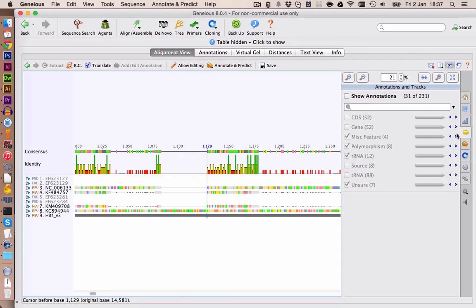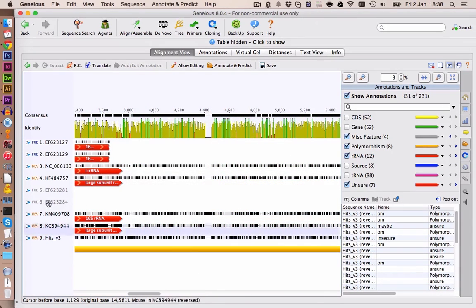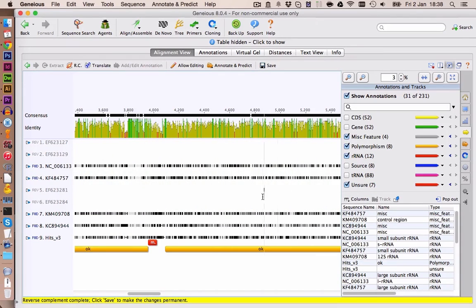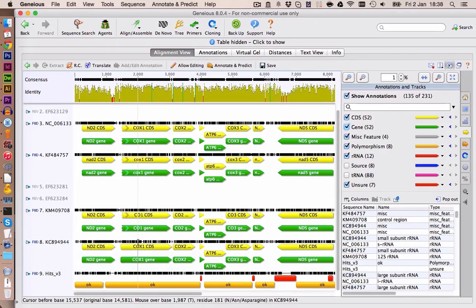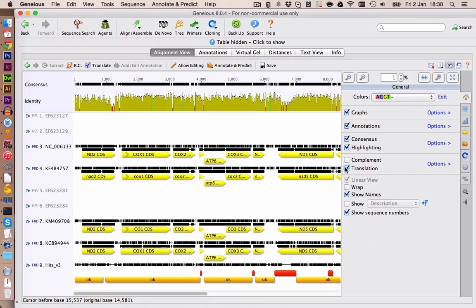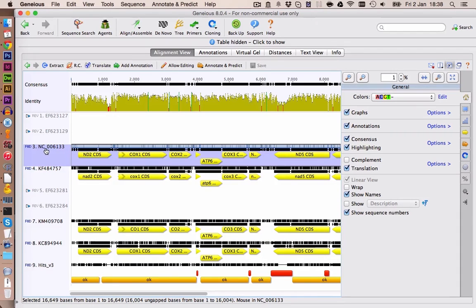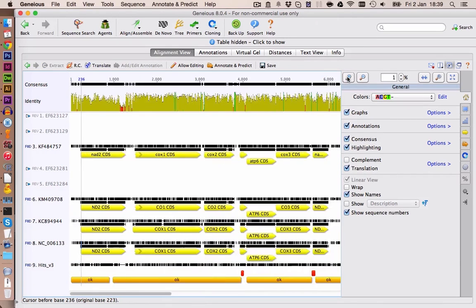Let's also add some annotations. And we see here the whole thing is reversed. So we click once on reverse complement to have it in the other direction. Let's include the translation and let's save this for now. And our reference genome was the NC one. So move it down here.